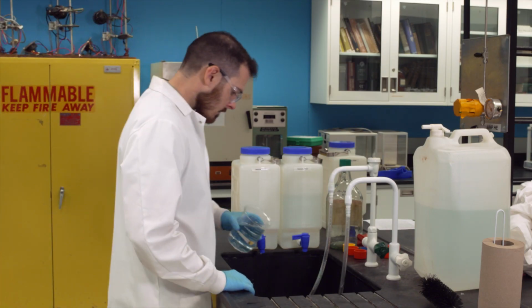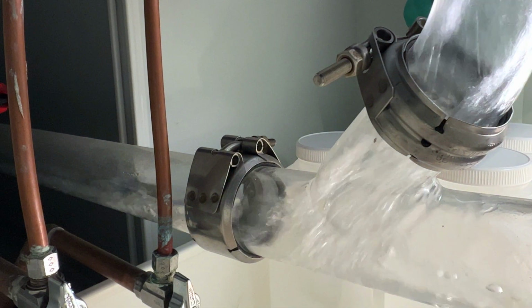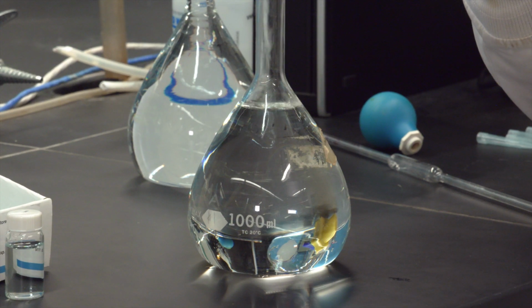With increasing amounts of trace metals ending up in wastewater, their impact on human health and aquatic environments are of interest. As a result, their quantification is desired. For this experiment, voltammetry will be used for the analysis of lead, cadmium, and copper in water samples.